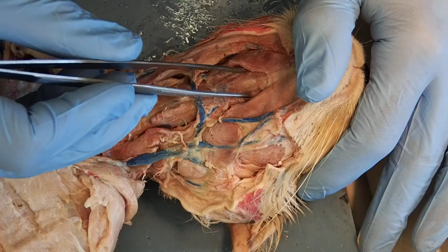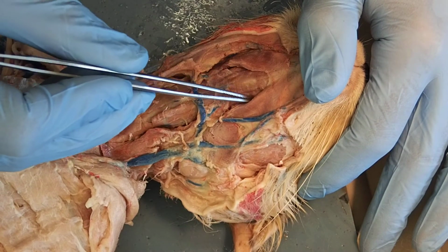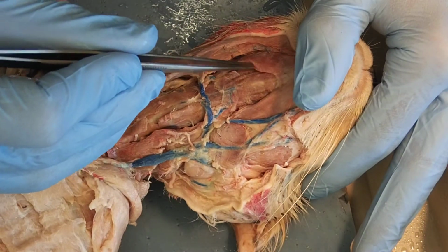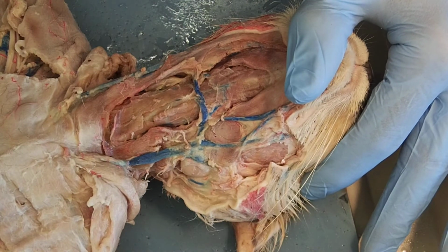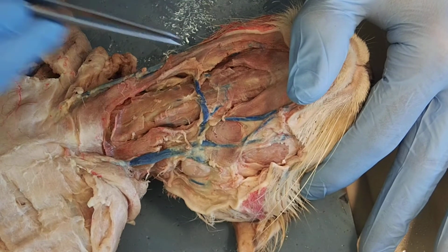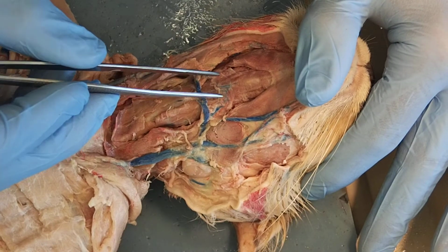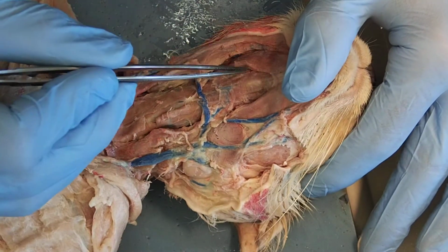Sitting deep to that, that's like a plate going across. And it's not a plate, it's a muscle. But a muscle that spans across, that's my mylohyoid. Mylohyoid. It connects down here by the hyoid, for sure. And I'm not quite sure what mylo comes from. But this would be my mylohyoid.